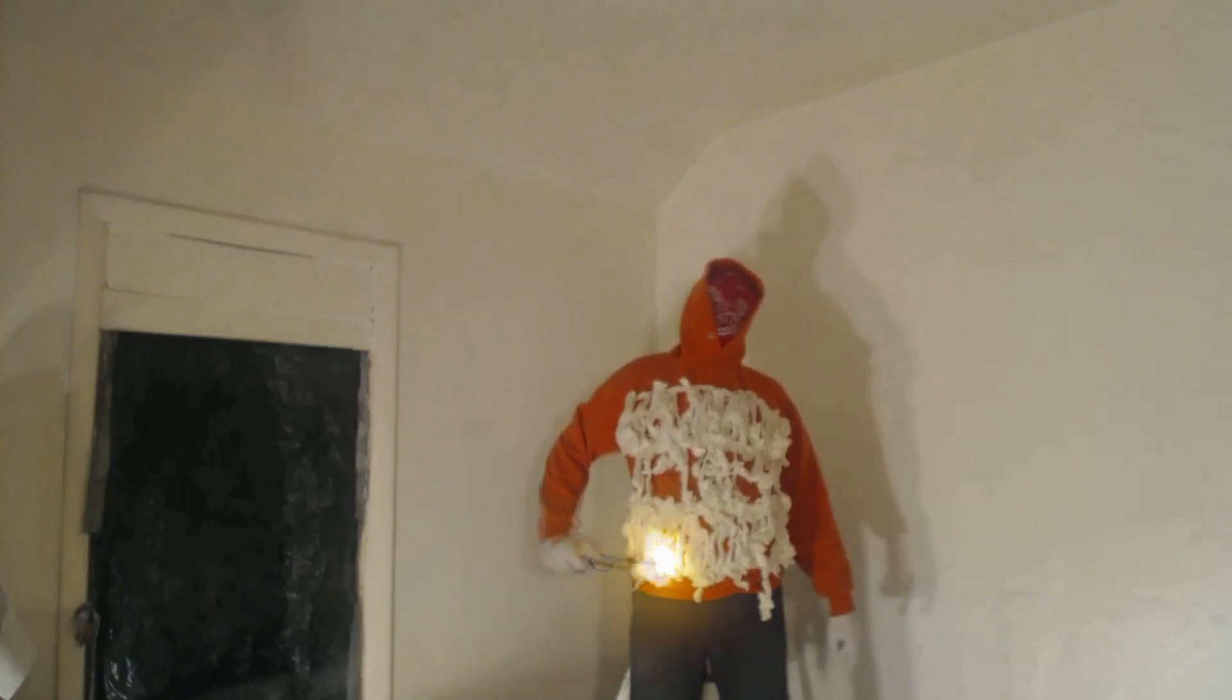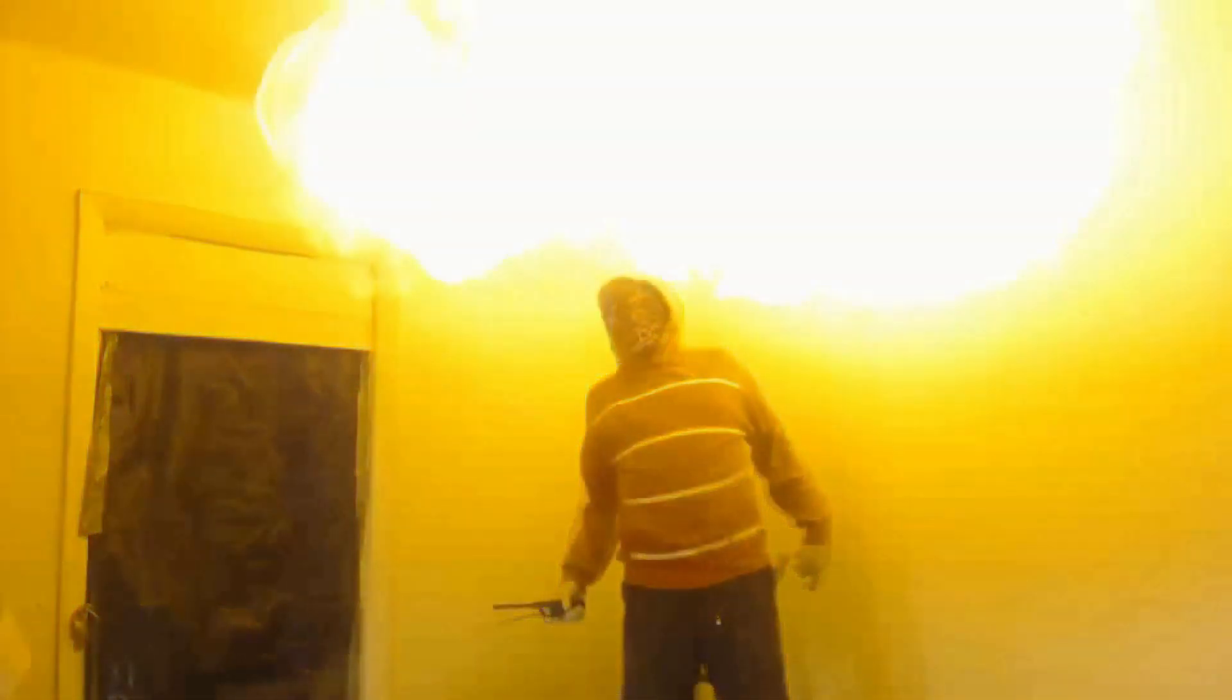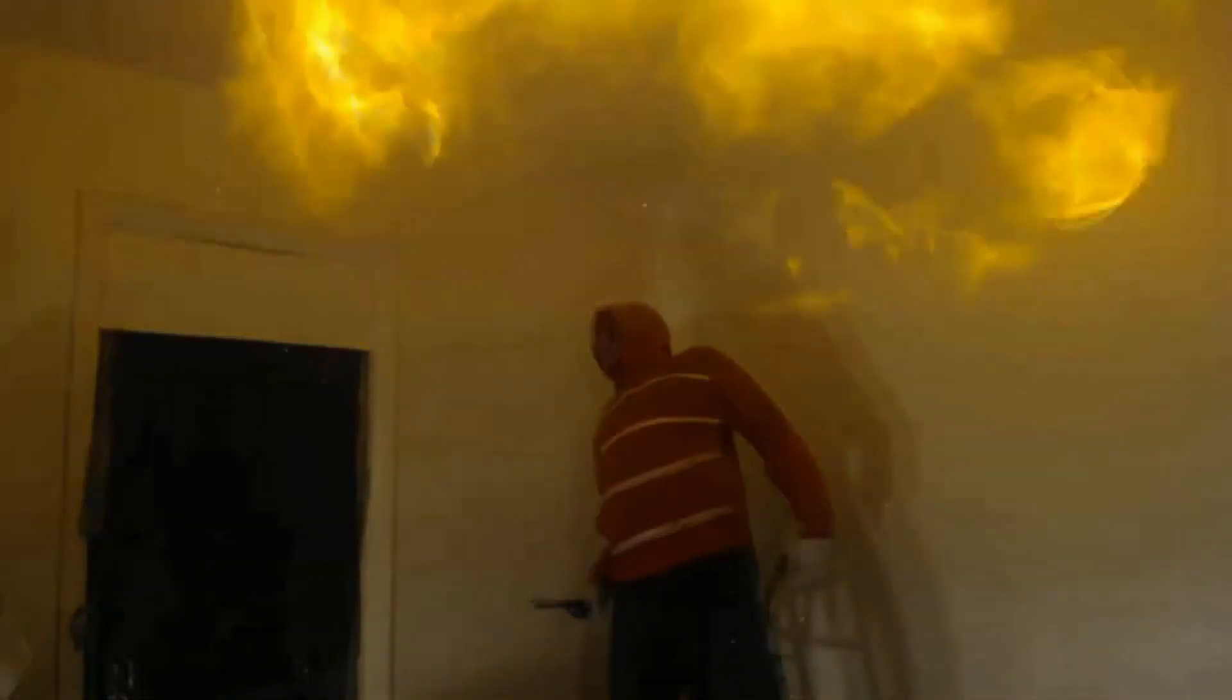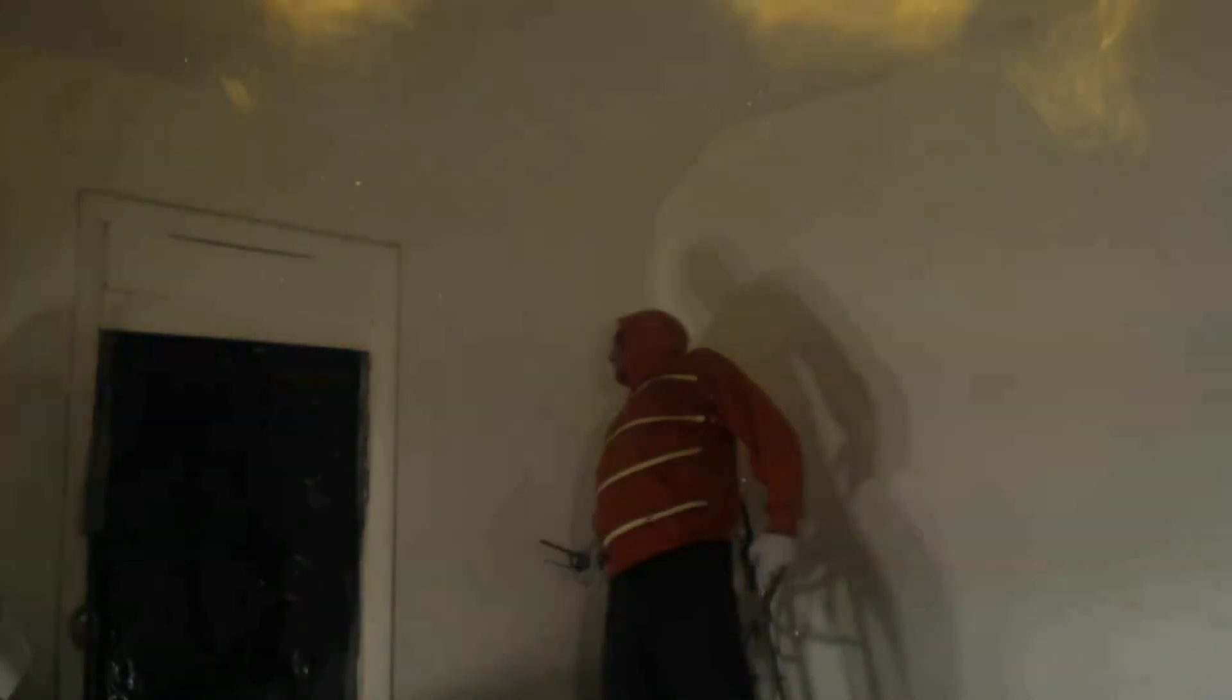This is John Black Superchemist. This is not an instructional video. It is just a blog showing a video account of some chemistry experiments I have done or I'm learning about. I do not go over all safety concerns, so if you repeat anything in the video, you do it at your own risk.